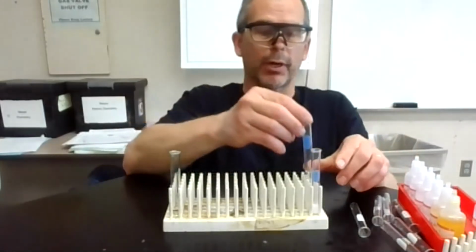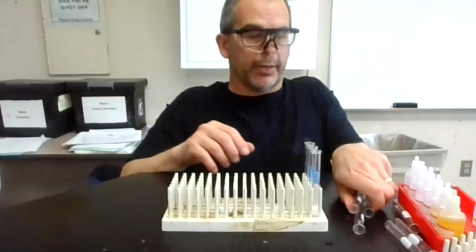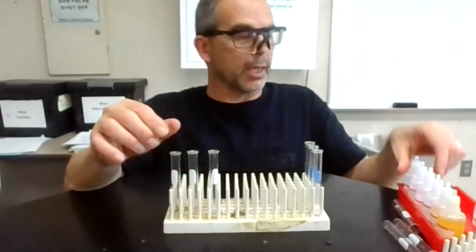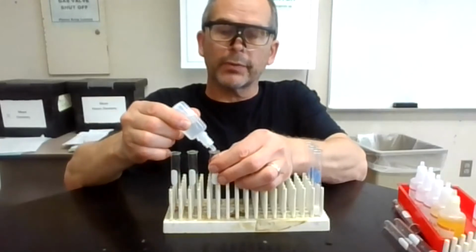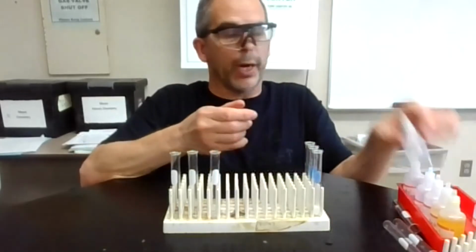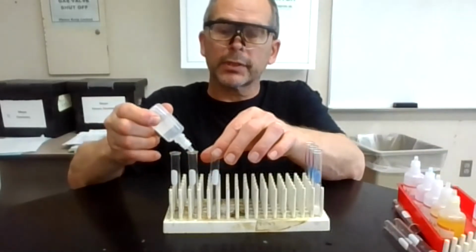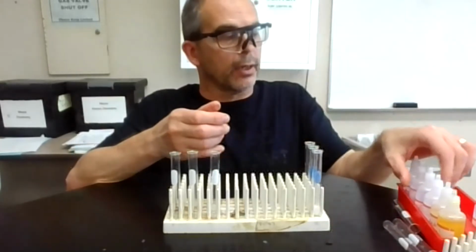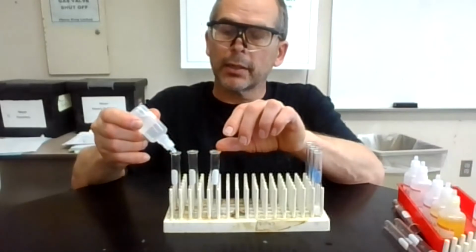Maybe put this over here and we'll come back to it and make sure we get that down in our data table. I'm going to take 3 more test tubes that I rinsed out, and I'm going to go back and repeat step 1 where I put silver. 1, 2, 3, 4, 5, 6, 7, 8, 9, 10. In the next container, put barium. 1, 2, 3, 4, 5, 6, 7, 8, 9, 10 in that container, and then I'm going to put zinc in this container.